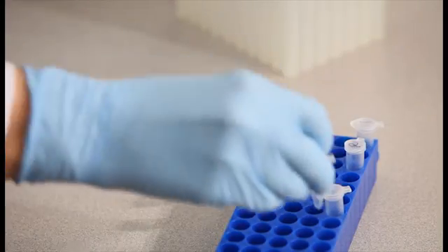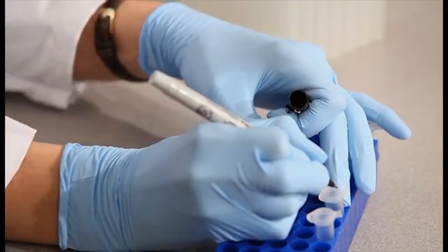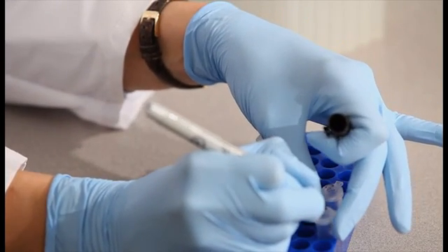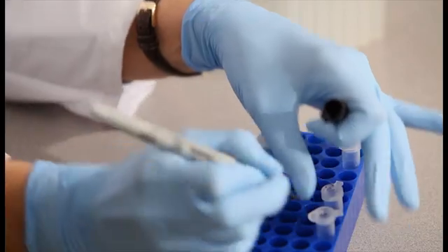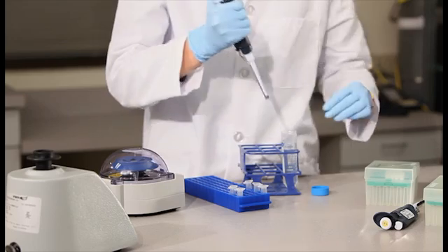The next step is to dilute the DNA extracts. Prepare to dilute the DNA extracts from all sample filters 1 to 5 by setting up and labeling a dilution tube for each sample. Pipet 80 microliters of nuclease-free water into each tube.